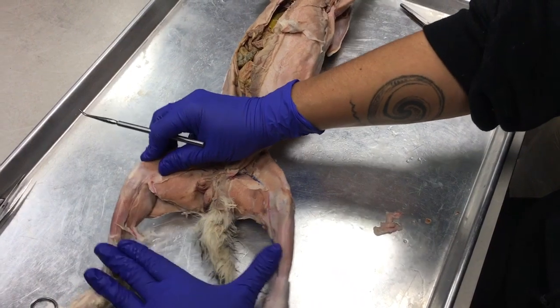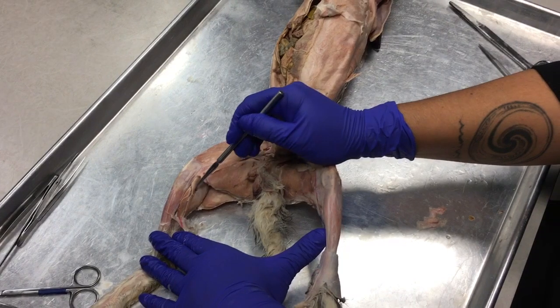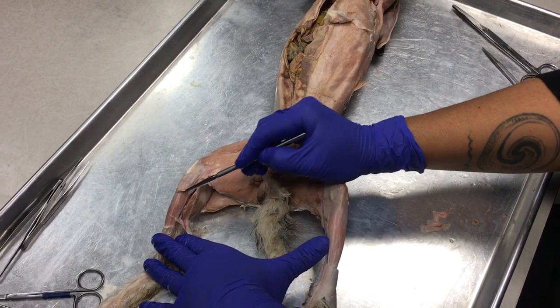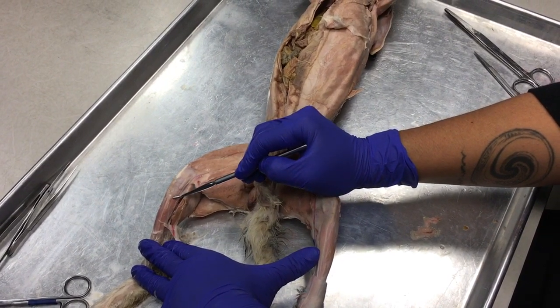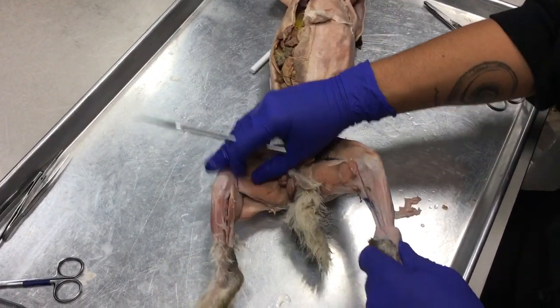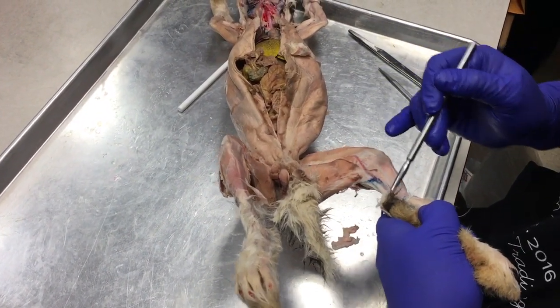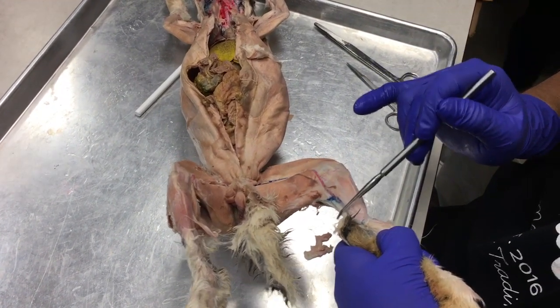Okay. Also, on the leg, we have our big calf muscle, gastrocnemius. Deep to that, we have our tibialis posterior, and then the anterior portion of the shin is covered by the tibialis anterior. Okay, so I don't care if you put anticus. I don't understand why it's a different name in every single thing. Okay, so the tendon that's holding the gastrocnemius muscle to the heel is this big white tendon here. This is called the Achilles tendon.